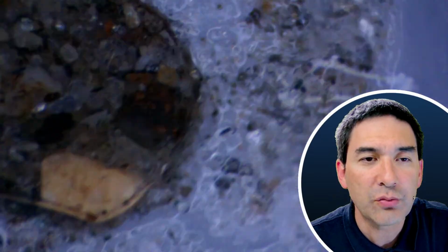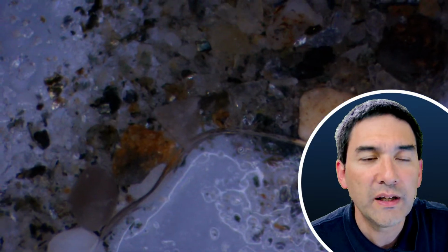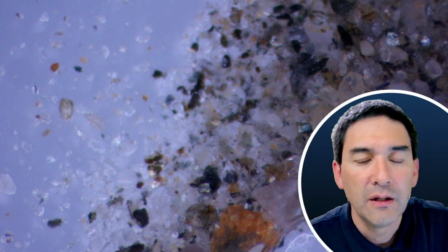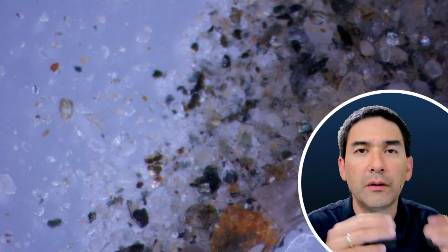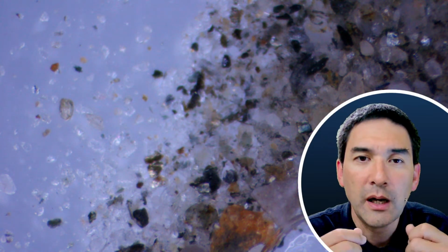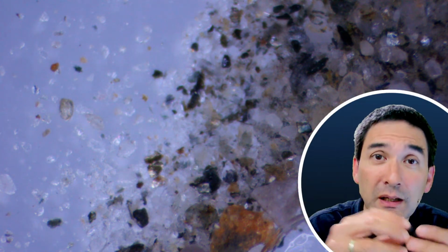It is to try to do some kind of an extraction or purification process to separate the larger sand grains from the other material that I have in here. One way of doing that would, of course, be according to density. So I could take the sand, put it into a small tube, and shake a little bit.